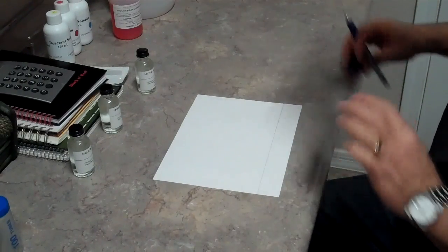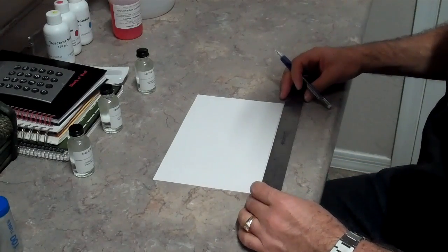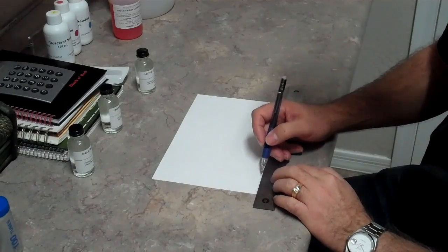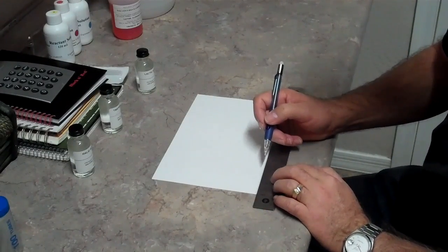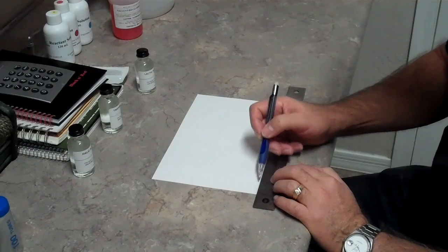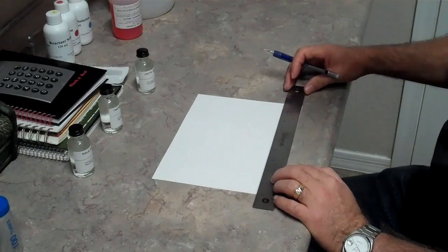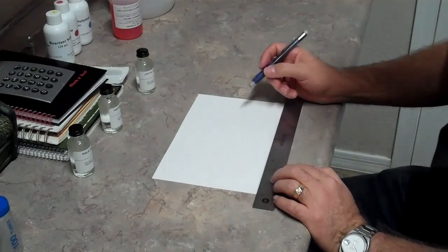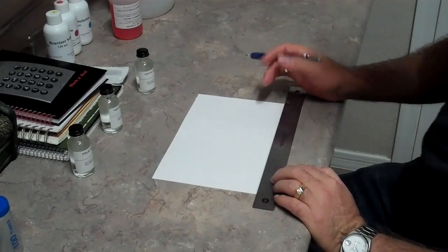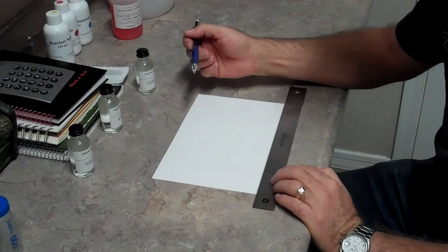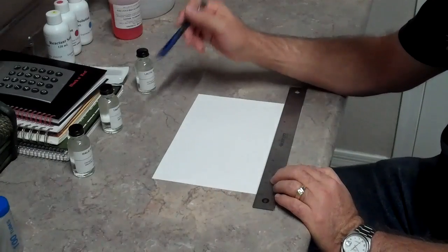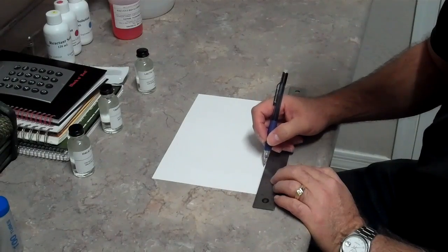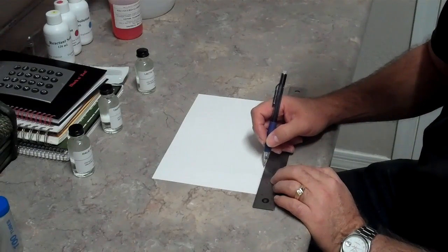We've got a line that we've drawn and we want to put a little mark, whether it's a dot or an X, approximately every inch apart. You don't want to be any closer than an inch from either edge. I'm going to start my first mark at about an inch and a quarter. I'm going to need a total of six places to put either wine or the acid down, so I'm going to go an inch and a quarter in, and then I'm going to go an inch apart after that.